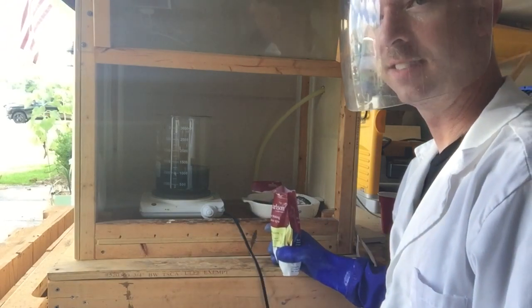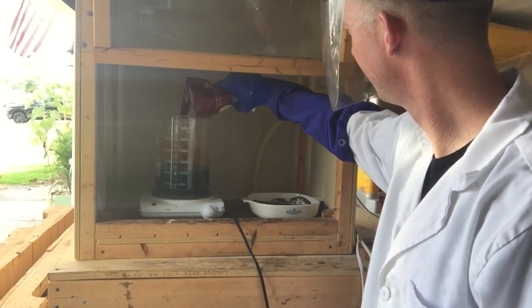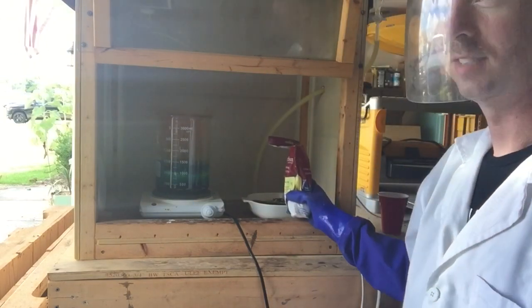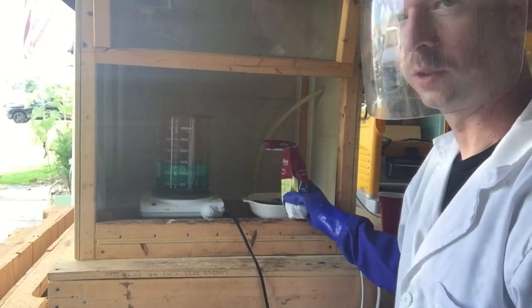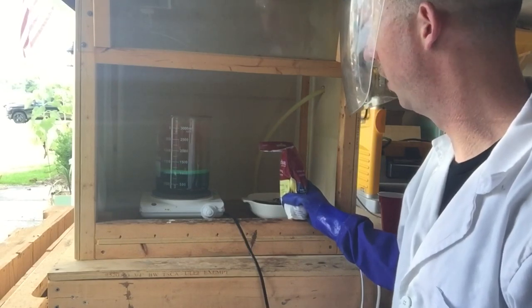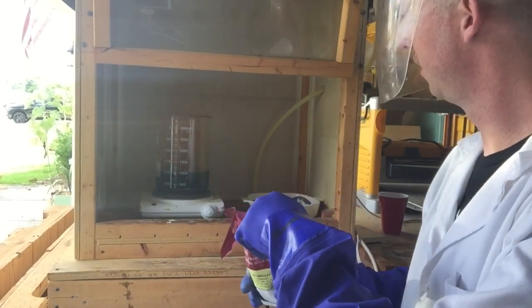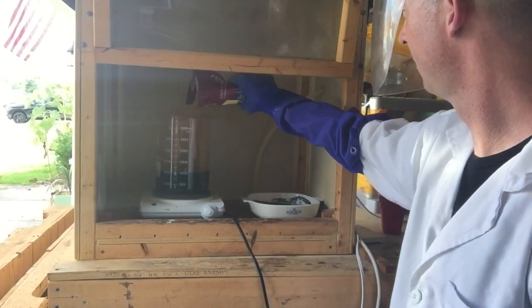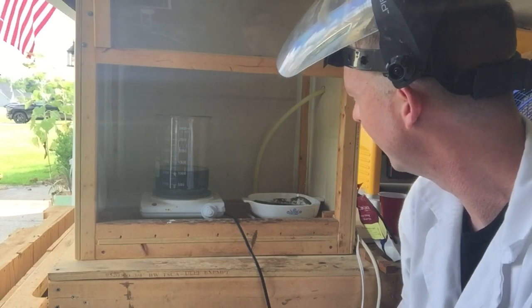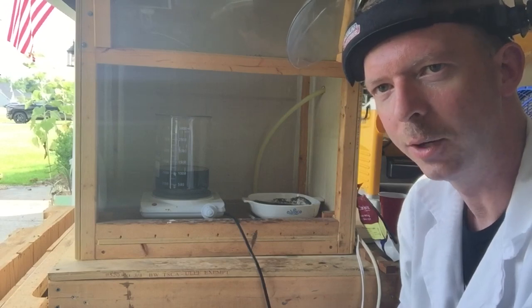The next thing we're going to do is take it back over to our fume hood, drop the gold out with sodium metabisulfite, and probably let it set overnight. We'll get both our silver and gold melted up tomorrow. We'll start adding in our sodium metabisulfite. It's going to have to neutralize any excess nitric acid first — the gold's coming out and then getting re-dissolved because of the excess nitric, so we'll just have to wait until we get through all that and the gold should stay out of solution. Looks like we've got it all dropped — it's not fuming anymore. I'm going to wait a little bit, get this filtered up, and get it ready to melt tomorrow.